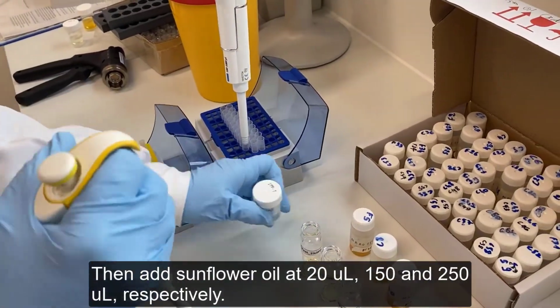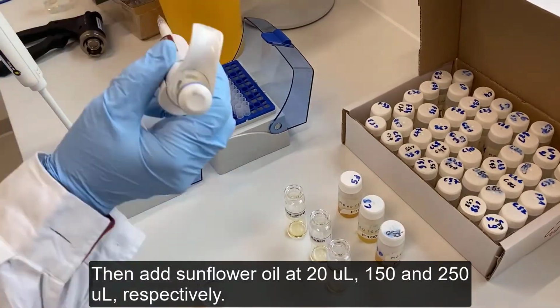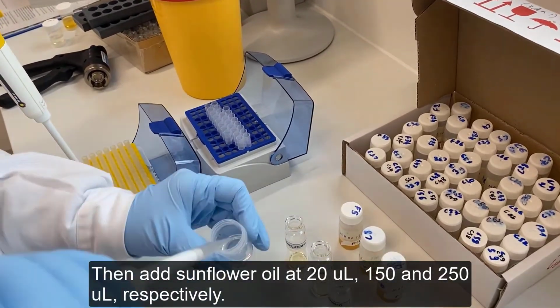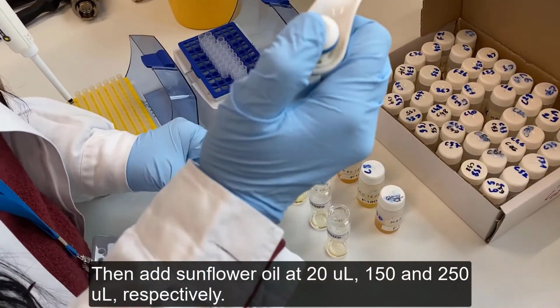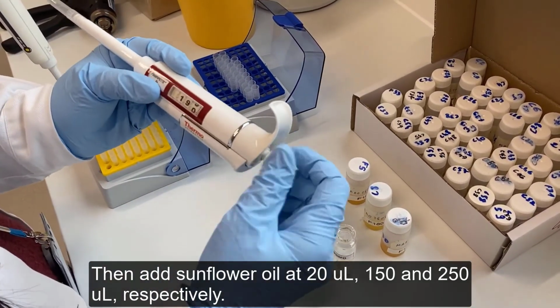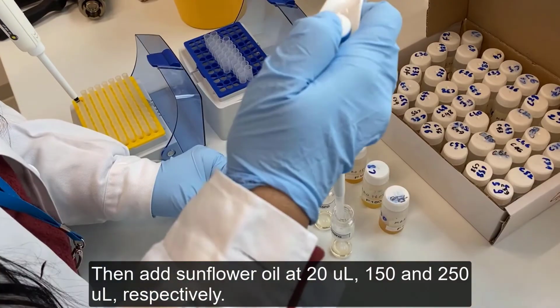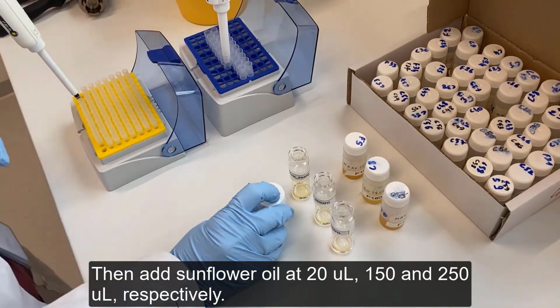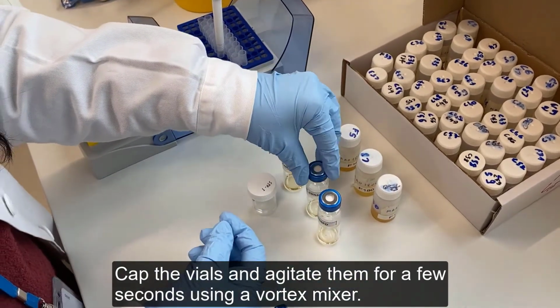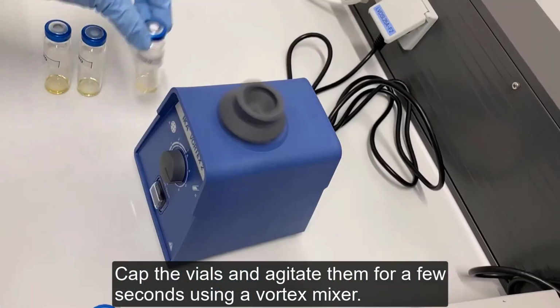Then add sunflower oil at 20 microliters, 150, and 250 microliters respectively. Cap the vials and agitate them for a few seconds using a vortex mixer.